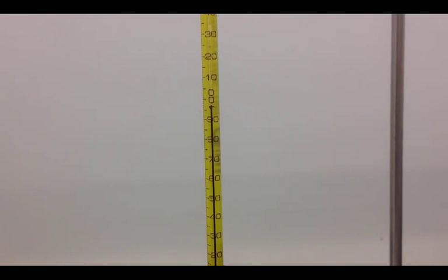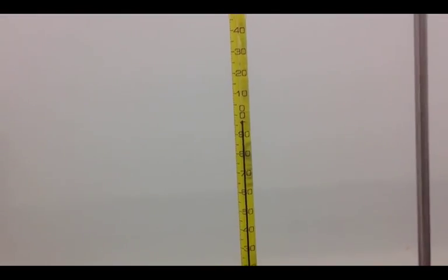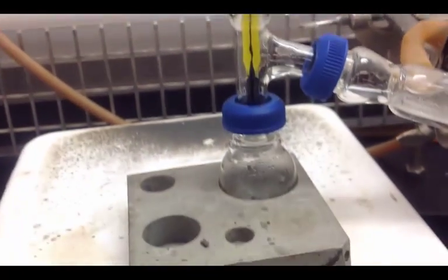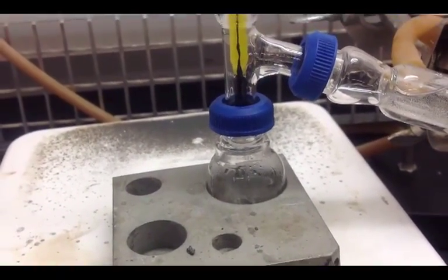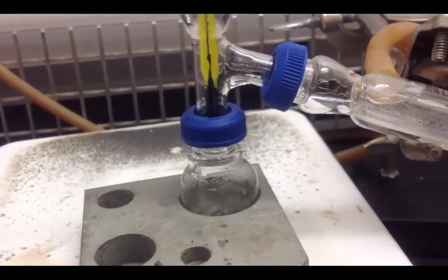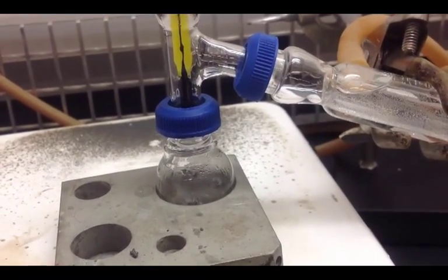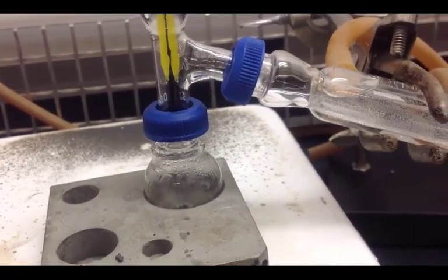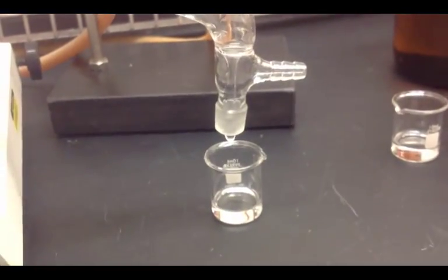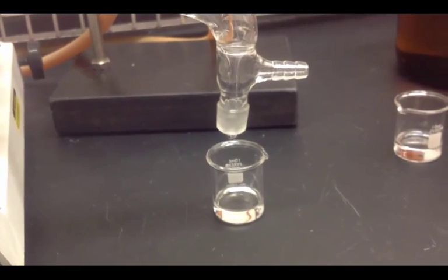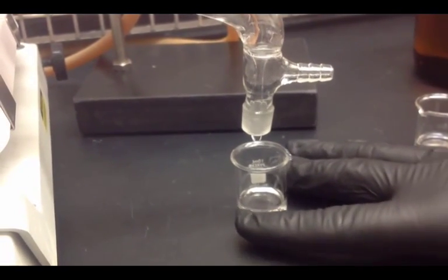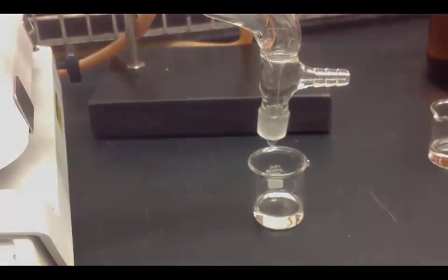All right and right now we are just about almost at 100 degrees Celsius. And the boiling point of toluene if you remember is actually 110.6 degrees Celsius. We are not quite there. We are almost done with our distillation. As you can see there is not a whole lot of liquid left there. And we don't want to go all the way or else this whole thing could explode. And we really want to avoid that. So we are going to go ahead and stop right here. But this is going to be mostly toluene right here, our distilled product.